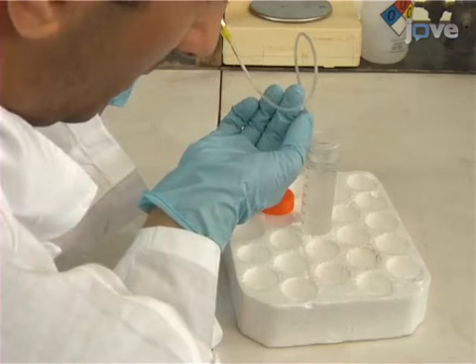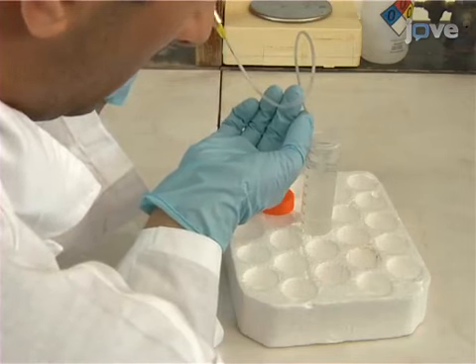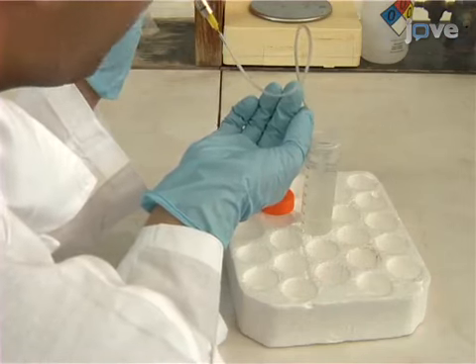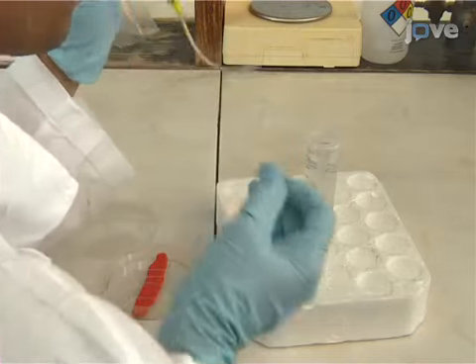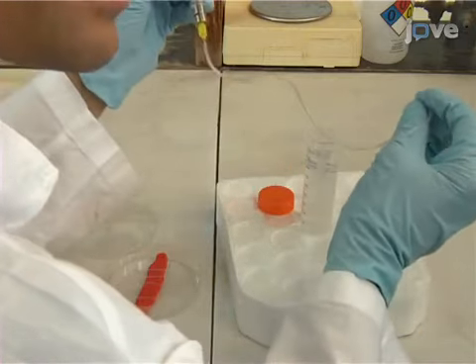Prepare the capillary such that the opening is nearly blocked but is sufficiently open to allow the formation of sub-millimeter bubbles.